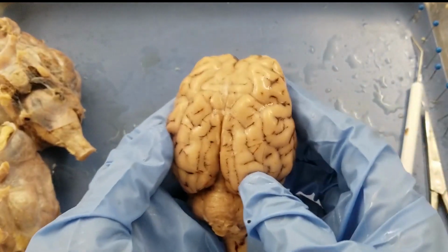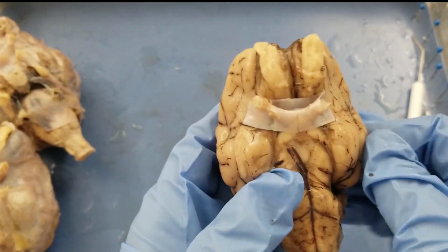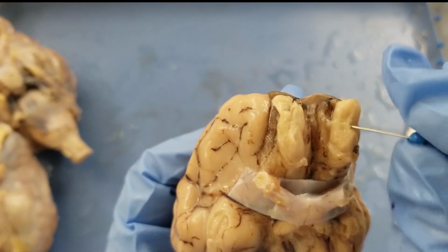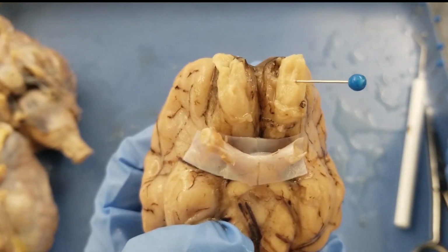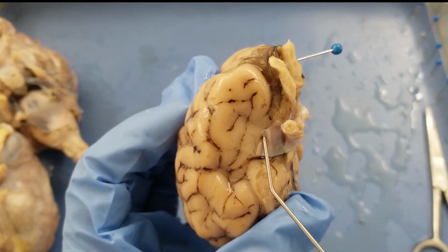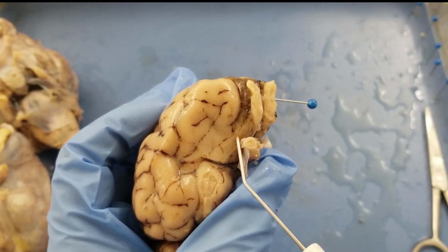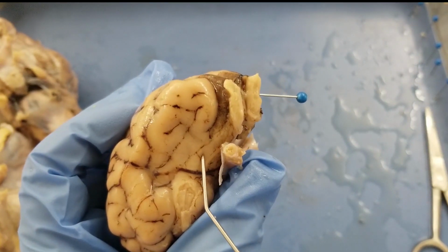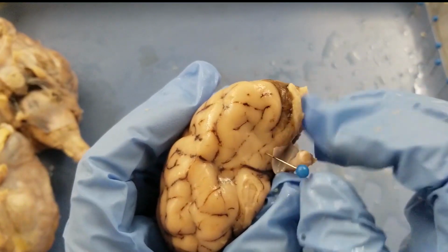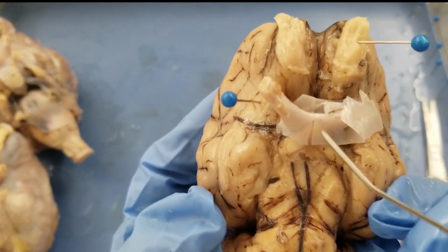Okay. Next step, we need to take a closer look at the ventral side of the brain. First, we need to label the olfactory bulb, which is this yellow thing here, right? So the olfactory bulb, and then the olfactory tract. After the olfactory bulb, there is a structure that goes along the brain. See here? That is the olfactory tract. I'm going to label that. And next one, the infundibulum. It's also called the pituitary stalk.